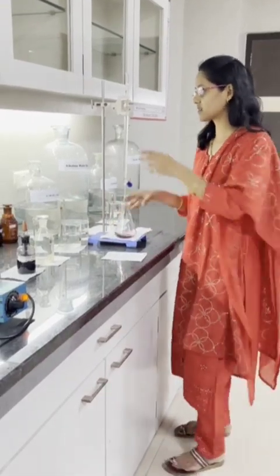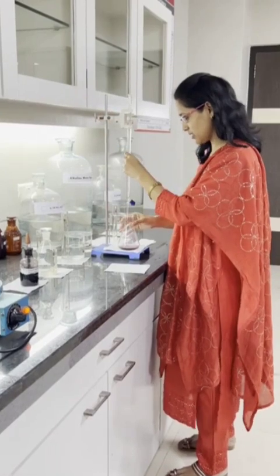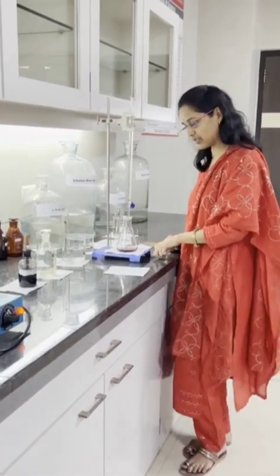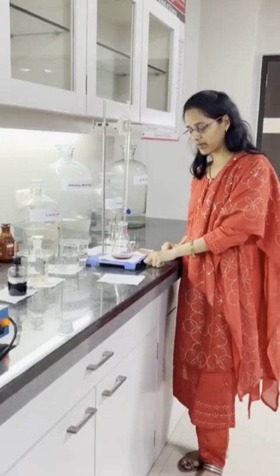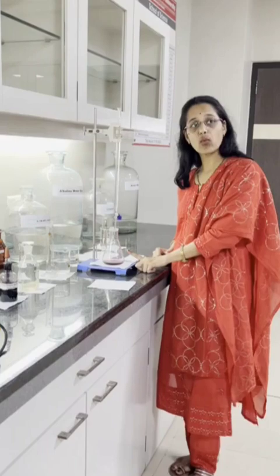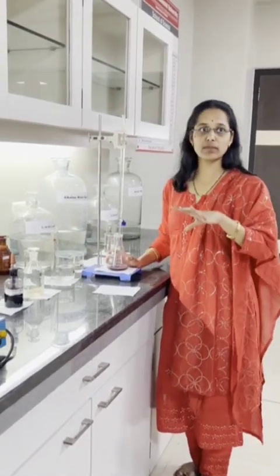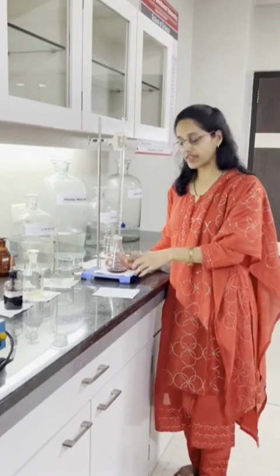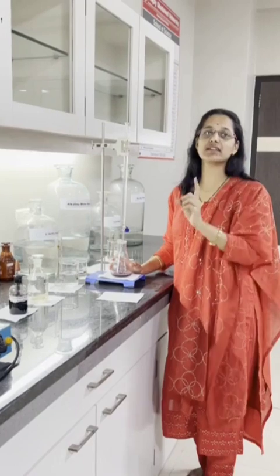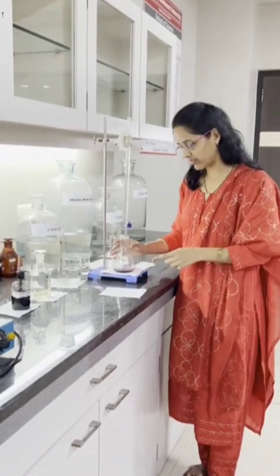Already this burette is filled with the EDTA solution — ethylenediaminetetraacetic acid. This is the water sample. We have added the EBT indicator and we are getting the wine red color. Whatever Ca²⁺ and Mg²⁺ from the water sample, they are combined with this EBT indicator, and this complex has a wine red color. So we can see the wine red color in the conical flask.